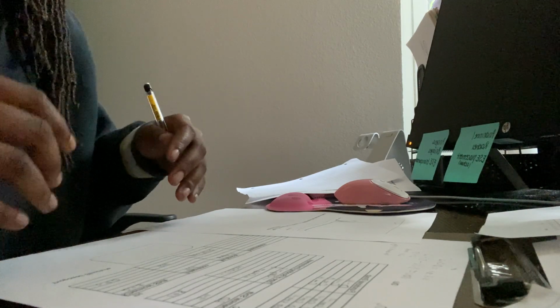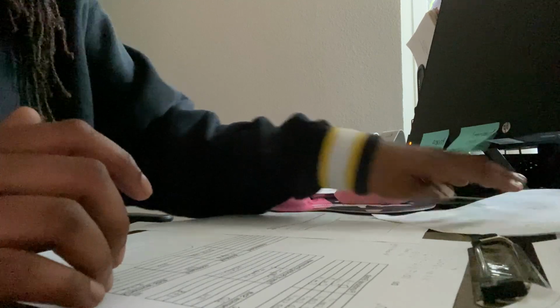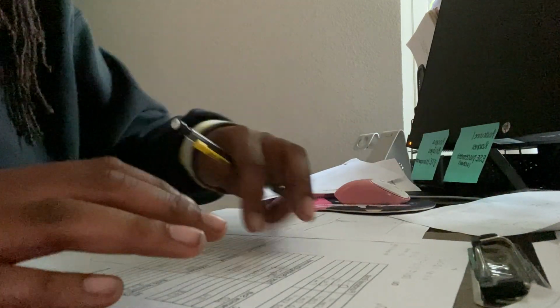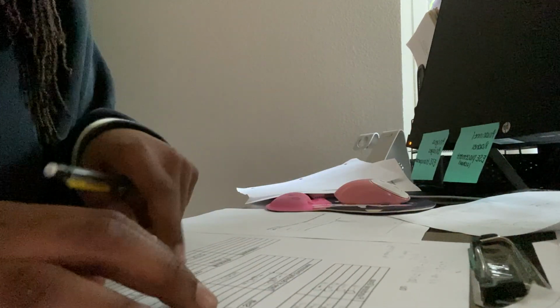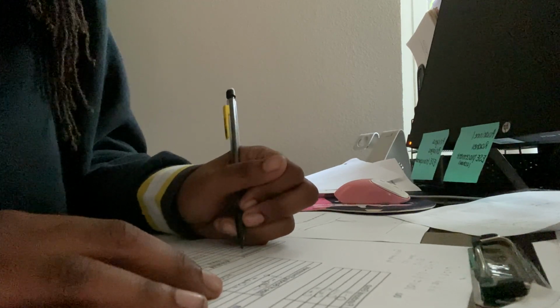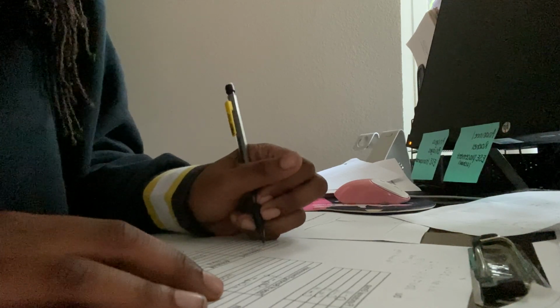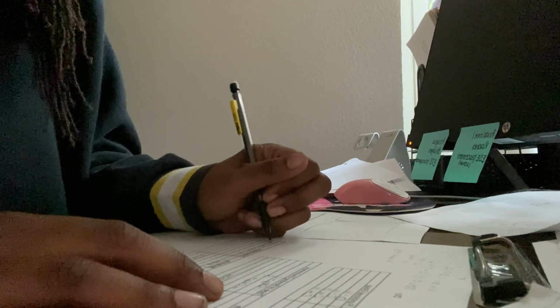From that, we're able to interpret the structure. And basically, I combine these two along with what I know with 4H triplet. So I have for this one, CH2, CH2, another CH2.